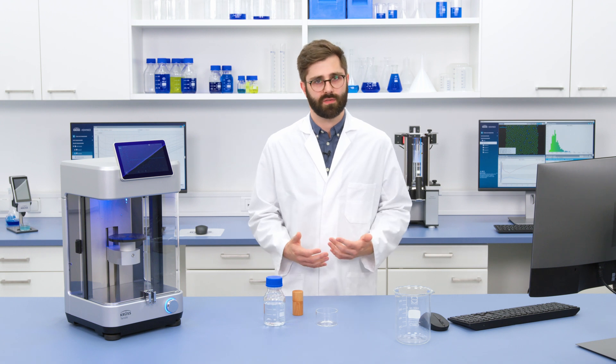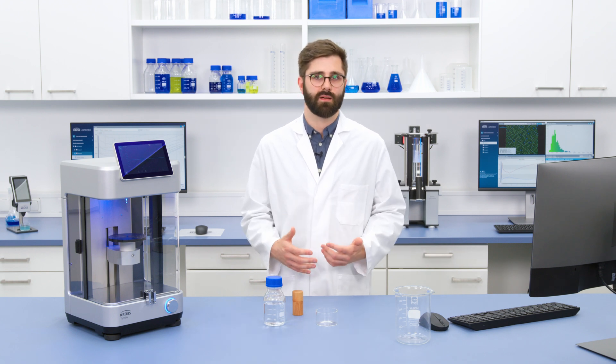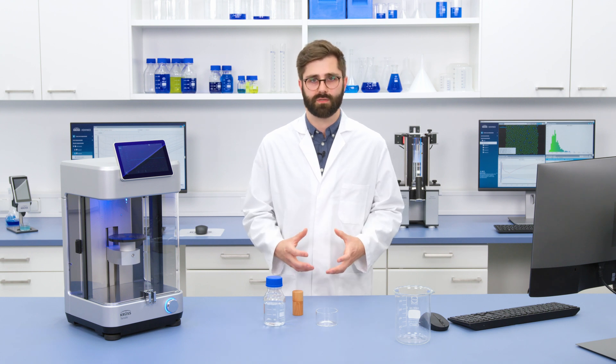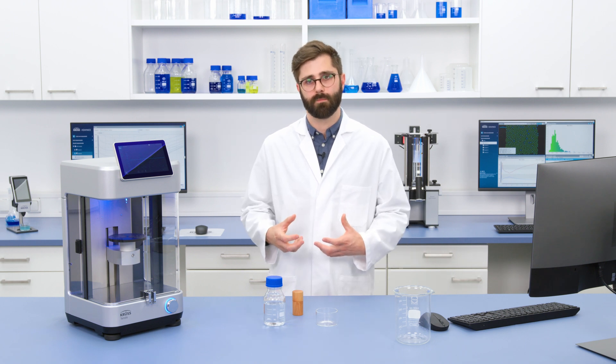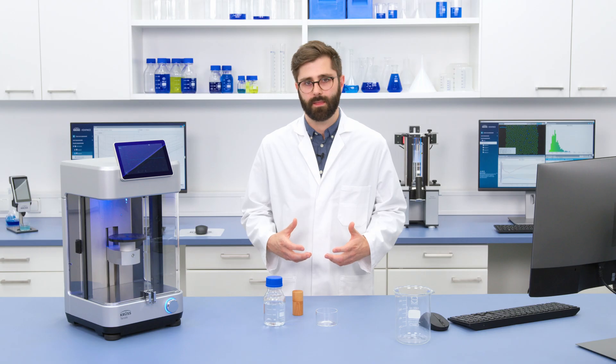In our lab, one of the most common uses of surface tension measurements is to assess the cleanliness of solid parts that our customers have sent to us for testing. This kind of test is a critical step when we begin a new troubleshooting project — when something is not working properly or there's a product failure, we need to find out the cause, and first of all we need to find out if contamination could be the underlying problem. This is especially useful if you have a production process involving a cleaning step, like a cleaning bath, or you're taking parts straight out of production and need to know there isn't any detergent residue left on the surface. Surface tension is a really sensitive parameter, so I can use it to detect even small amounts of contamination.